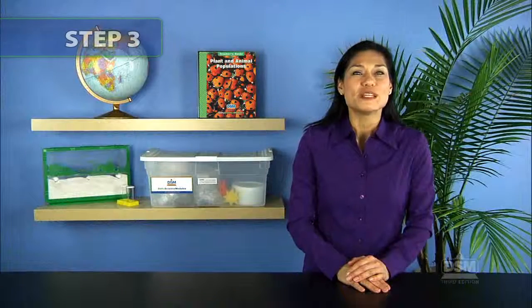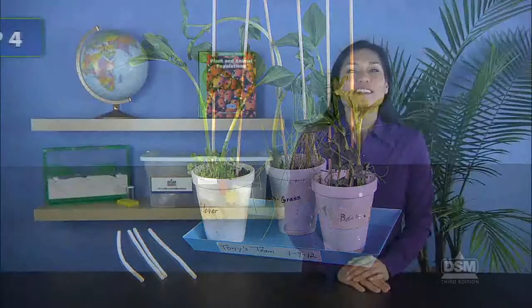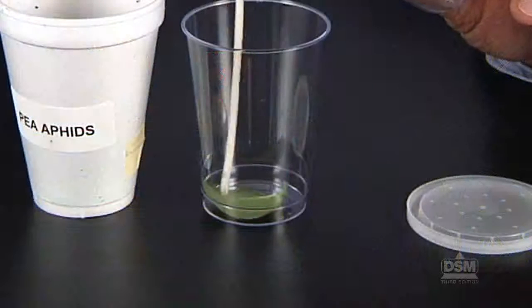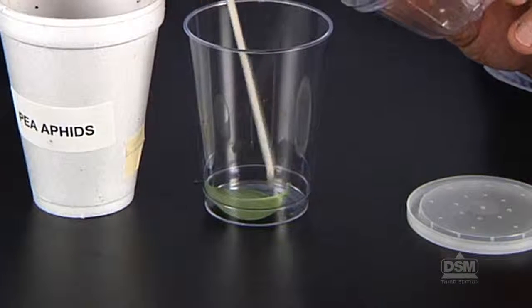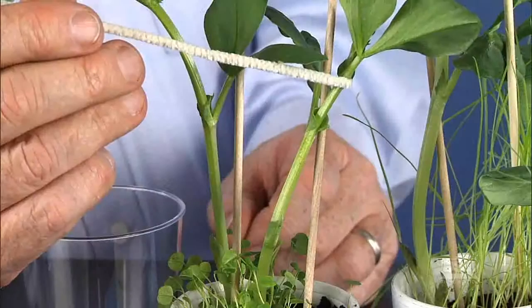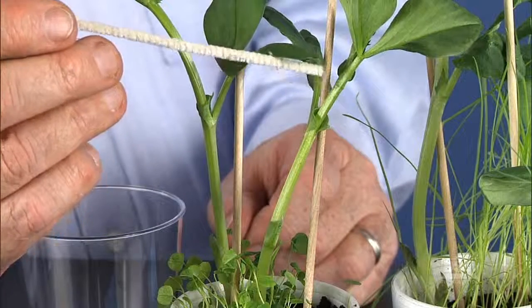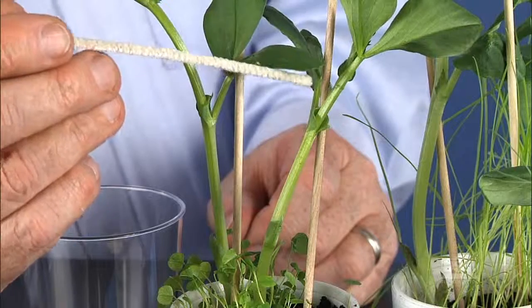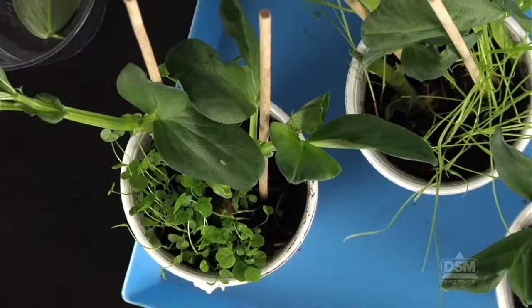Next, have teams retrieve their plants from Activity 2 and give each team 4 pipe cleaners. Then demonstrate how to move an aphid onto a bean plant by placing a pipe cleaner beside an aphid in the container and gently roll the pipe cleaner until the aphid clings to it. Then, move the pipe cleaner next to the intersection of a leaf and the stem of the bean plant and roll it again gently until the aphid climbs onto the bean plant.